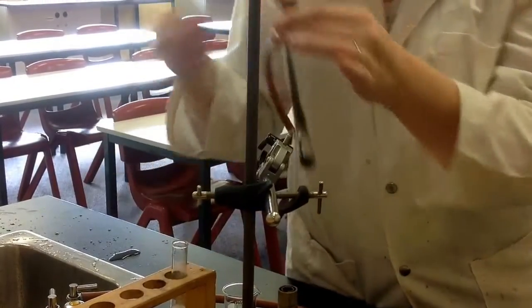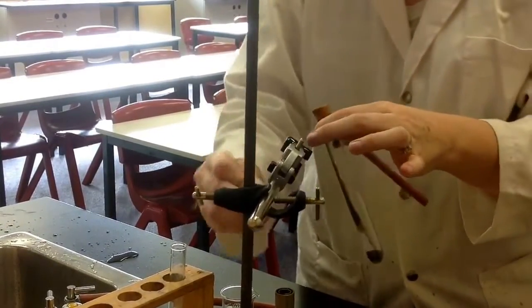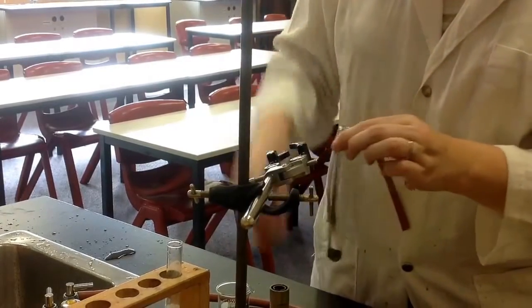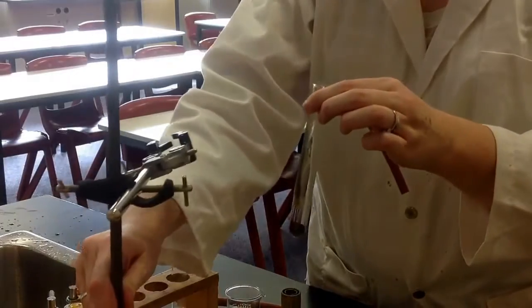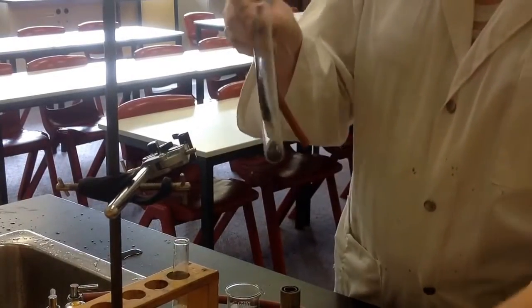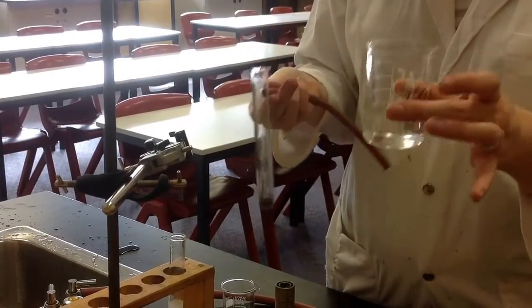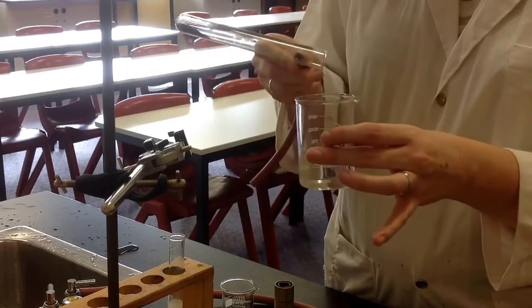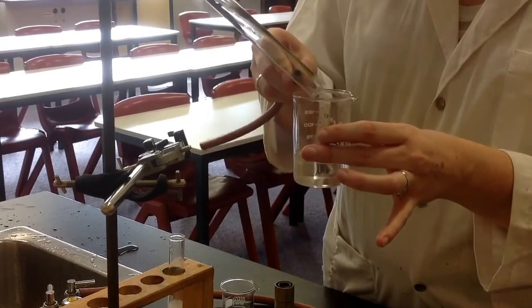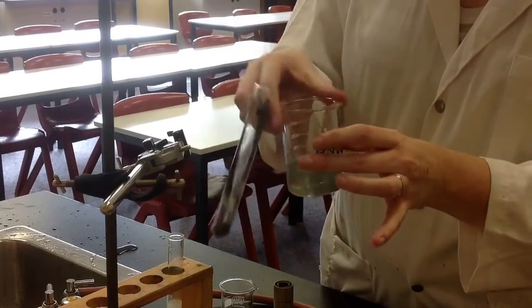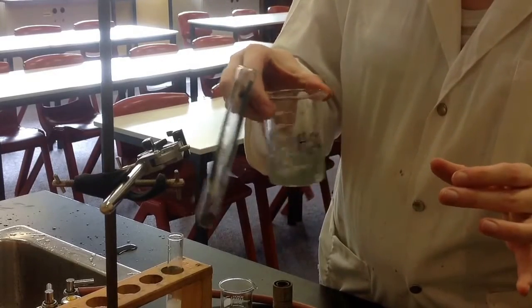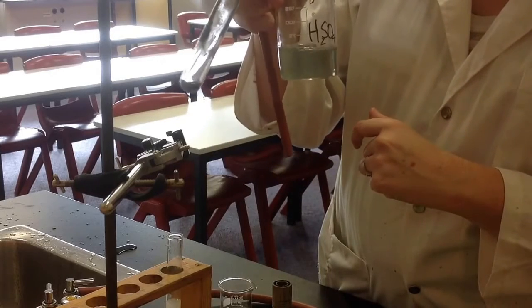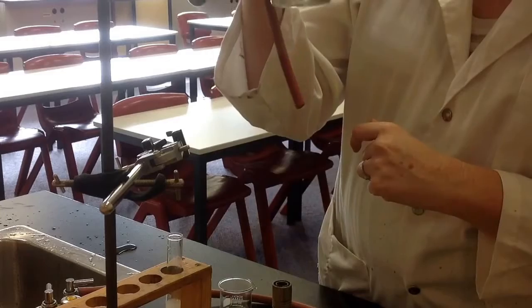A beautiful example of another chemical change. So if I get some sulfuric acid and I put some of this copper oxide in, still a bit of copper carbonate but we'll just see. And I put it in and I let it mix in a bit. I've put it in sulfuric acid, H2SO4. And you notice that the H2SO4 has suddenly gone a light blue color.